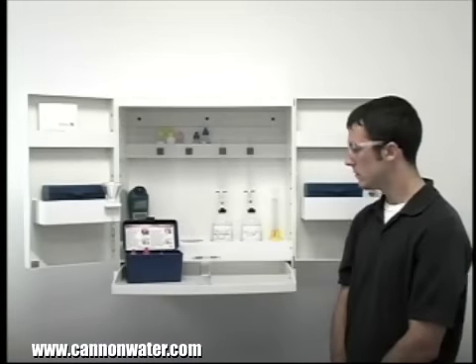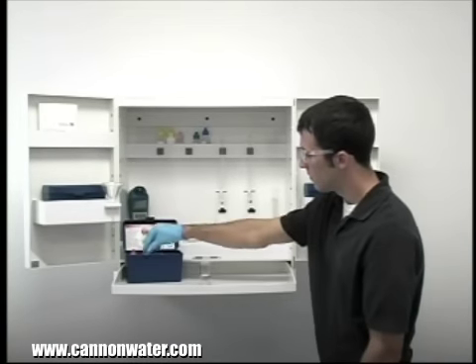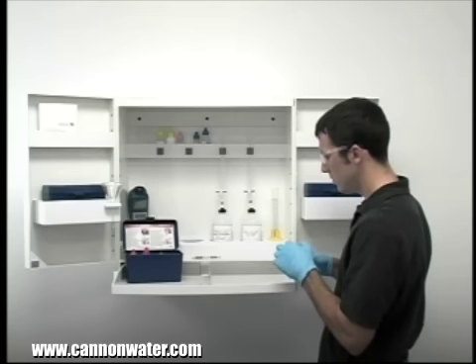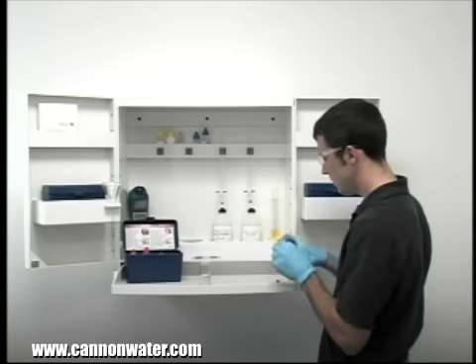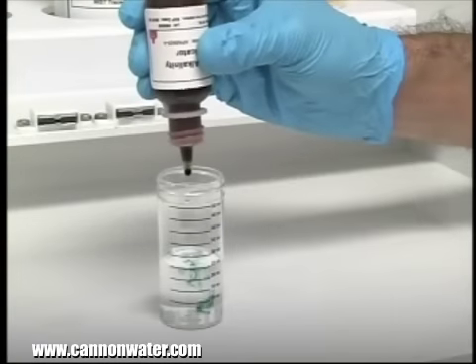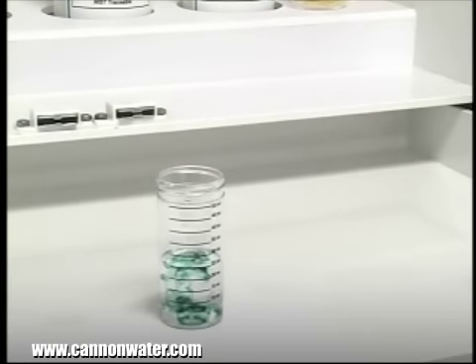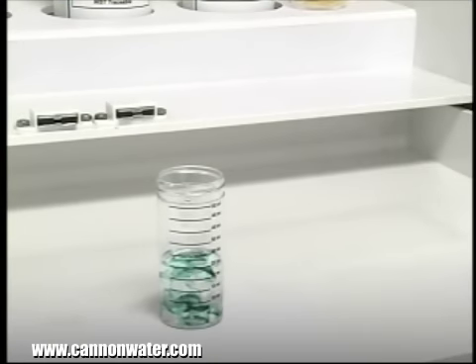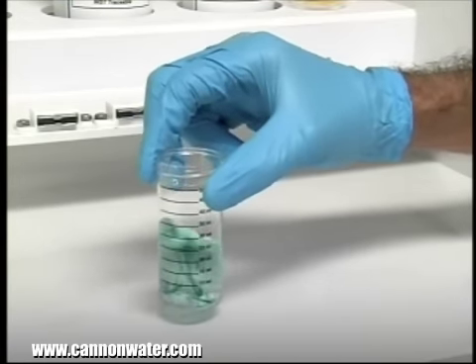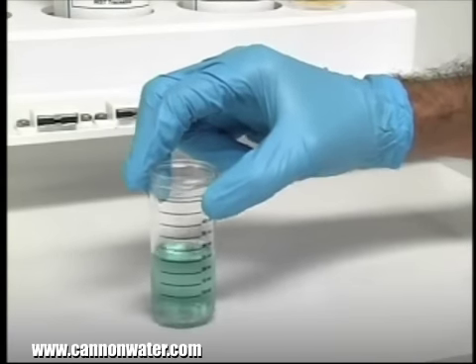The next step according to the endpoint ID procedure is to add three drops of the total alkalinity indicator. The bottle contains a dropper tip, so it's important to hold the bottle vertically to get a consistent drop size. After the addition of each reagent, swirl the vial to make sure the reagents are properly mixed. In this example, the sample turns green, indicating that there is still alkalinity that needs to be titrated.